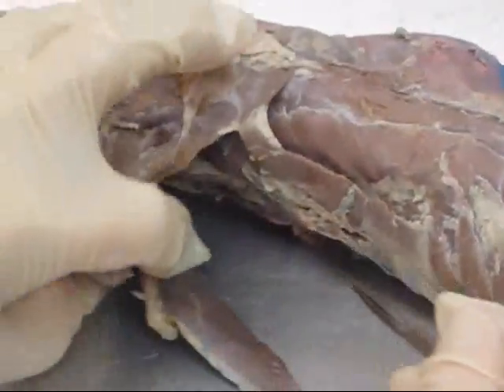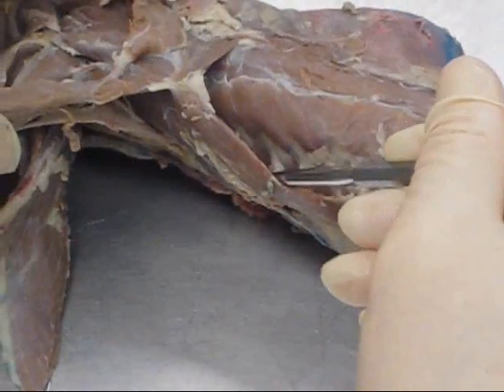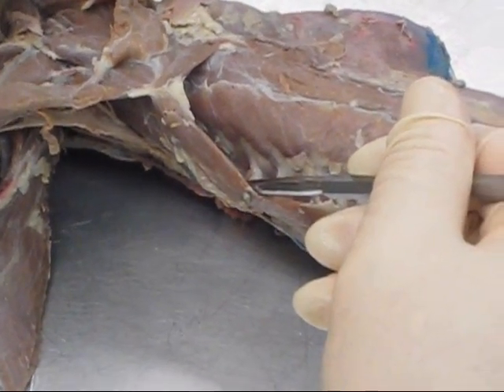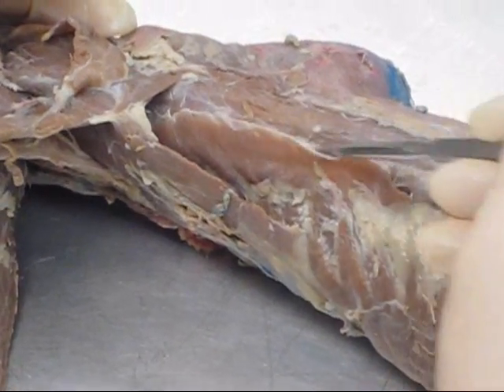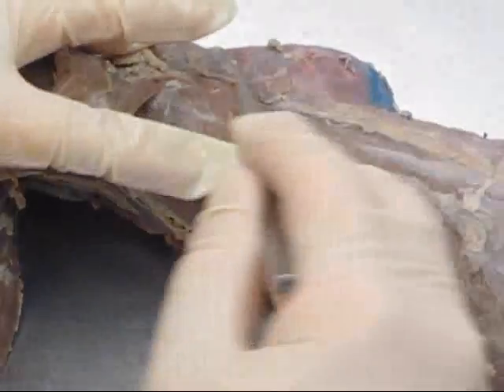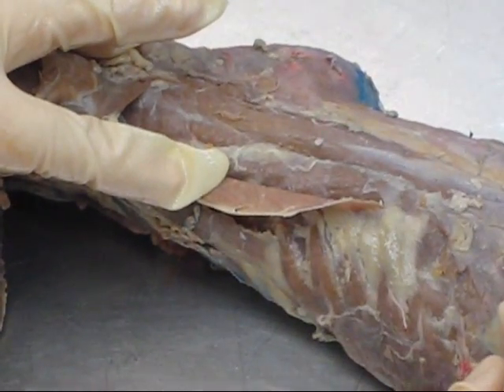You see some muscles here on the mink's side and back region. The first one here is serratus anterior, or serratus ventralis. This then would be serratus dorsalis, or serratus posterior. Then lastly, the big long muscle here was sacrospinalis.